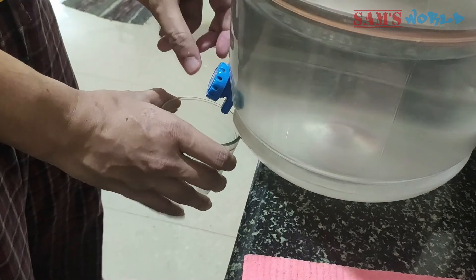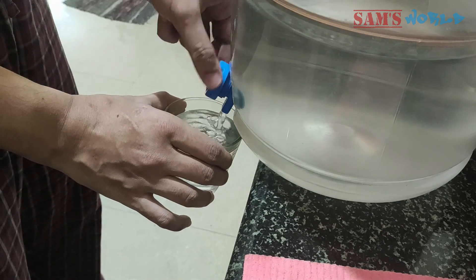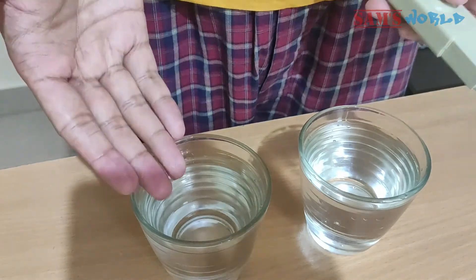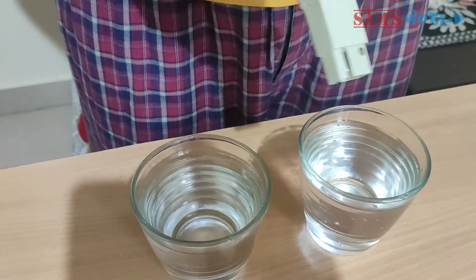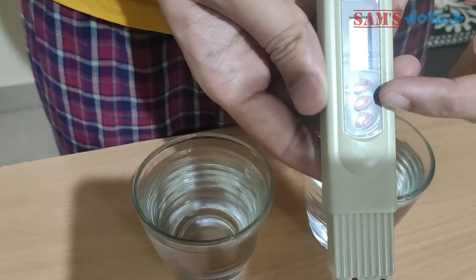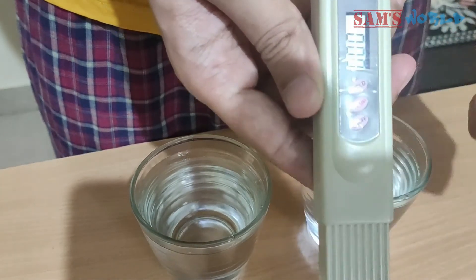I will take some drinking water in another glass. We now have two types of water — the left-hand side is the tap water and the right-hand side is the drinking water. I will use this TDS meter to check the TDS level of each. There are three buttons on the TDS meter: the first is on/off, the second is to check the temperature, and the third is hold.